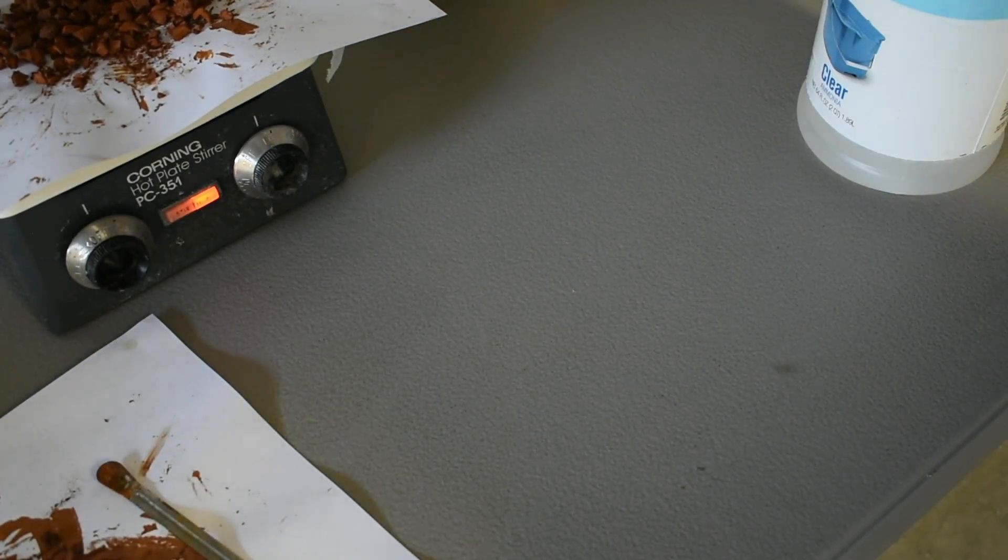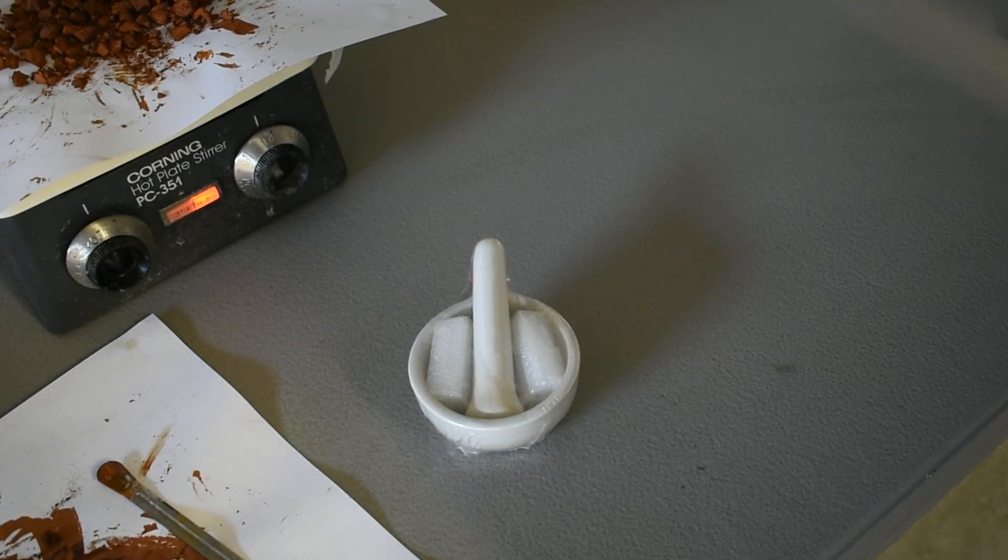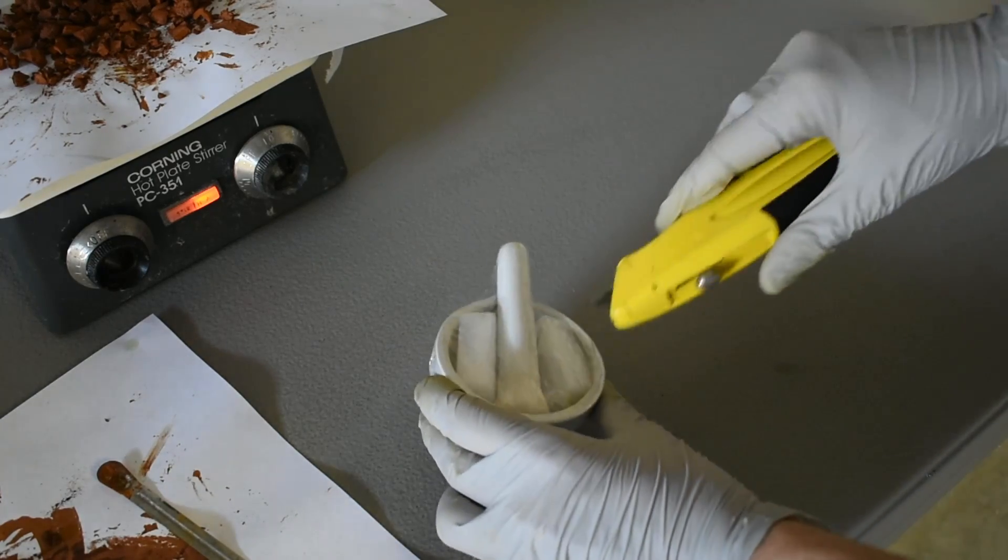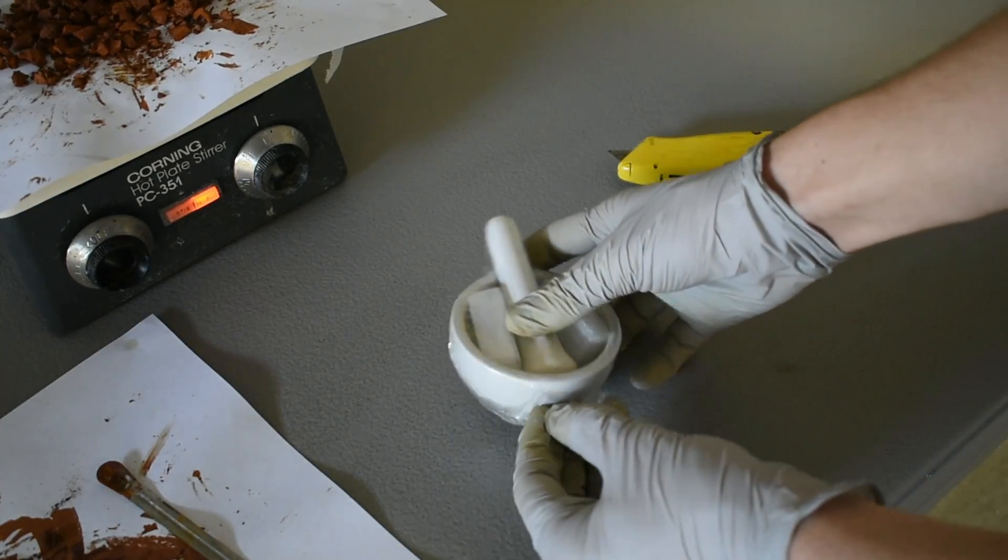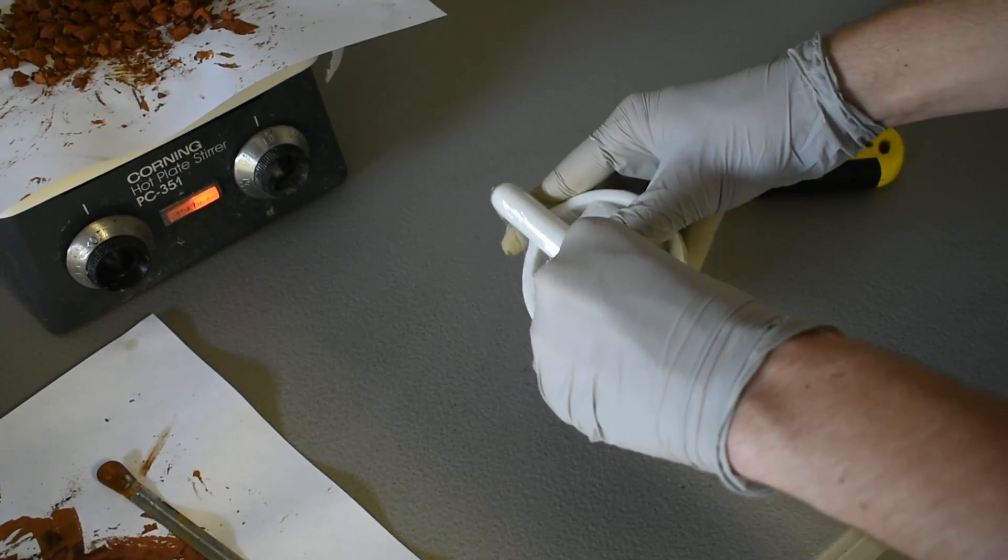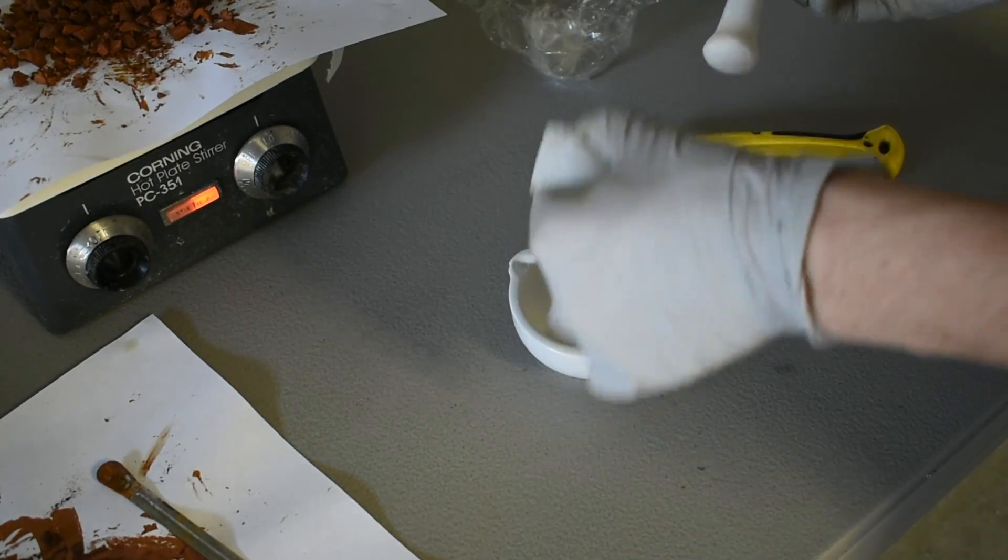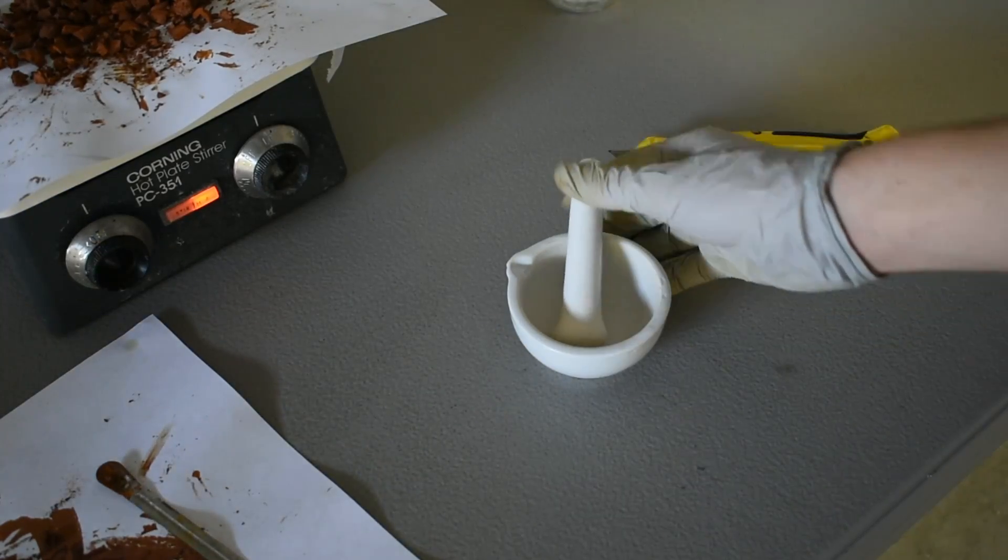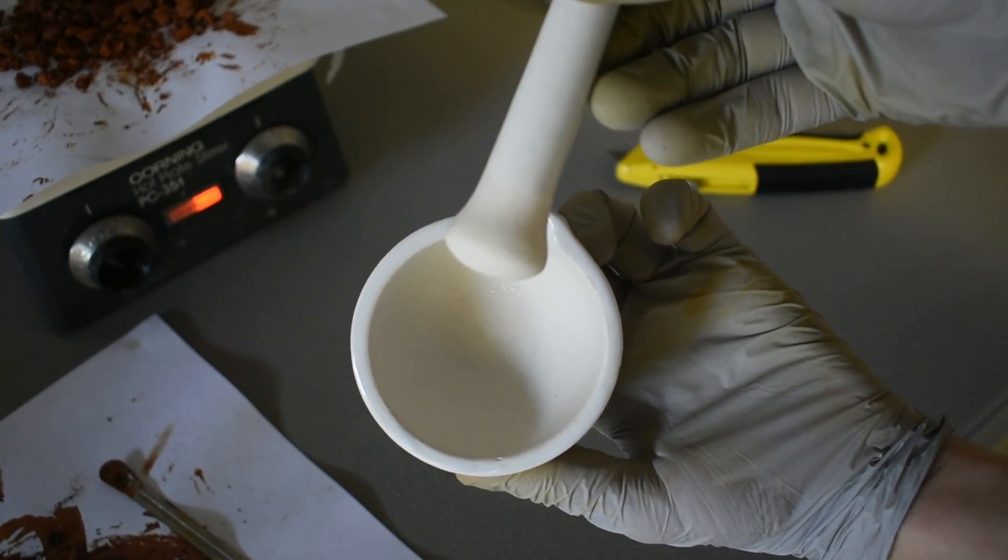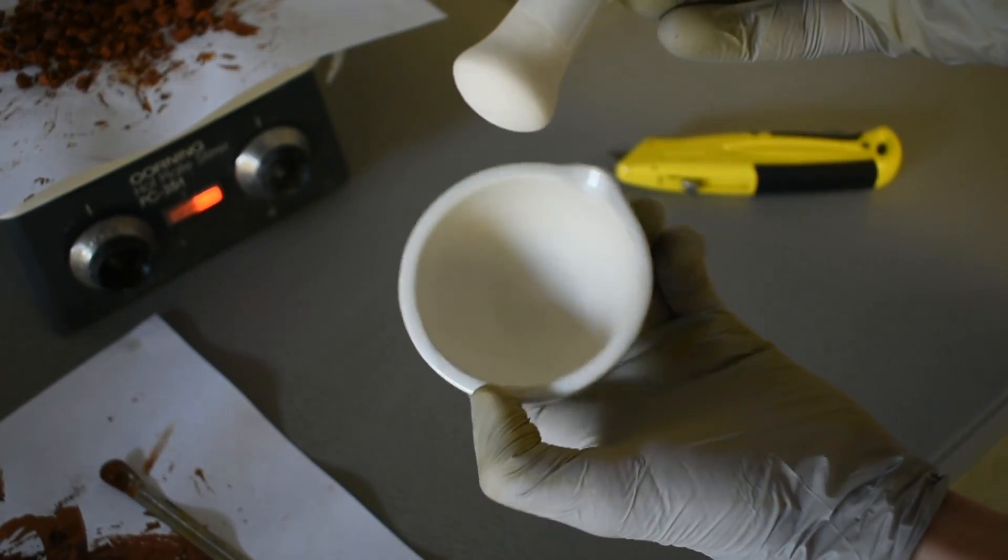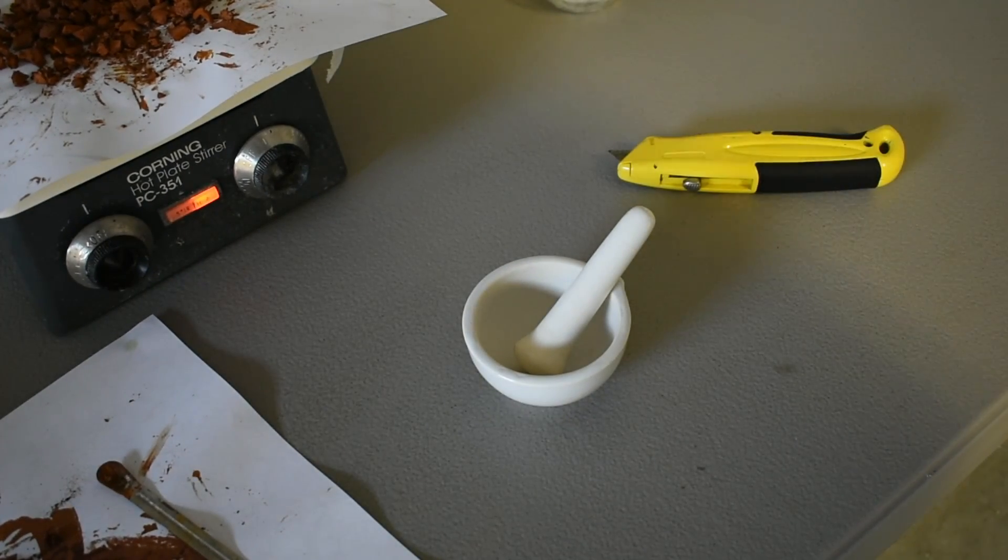And it is brand new. I thought I would share the pleasure of opening a brand new piece of equipment. So, here we go. There we go, brand new, perfectly clean. I'm going to go rinse this out, and then I'll be back. And we can crush up our copper ammonium chromite.